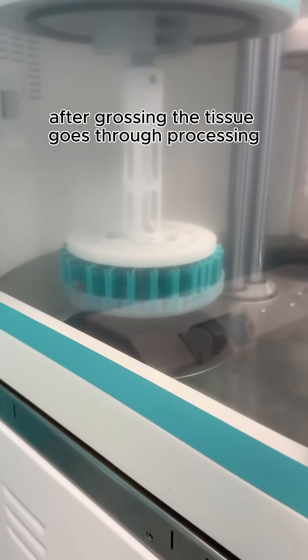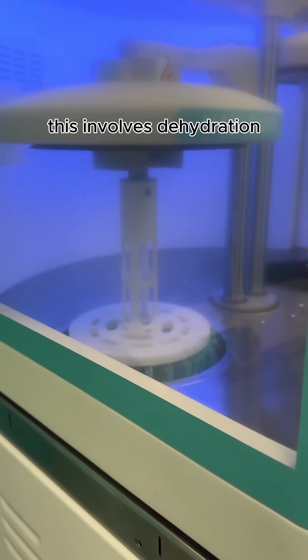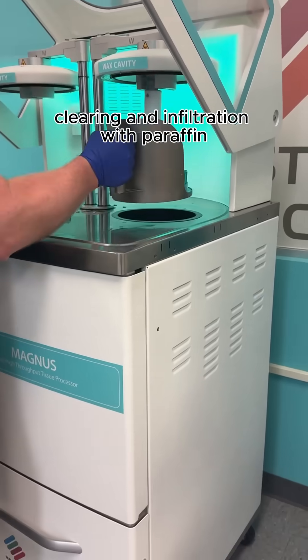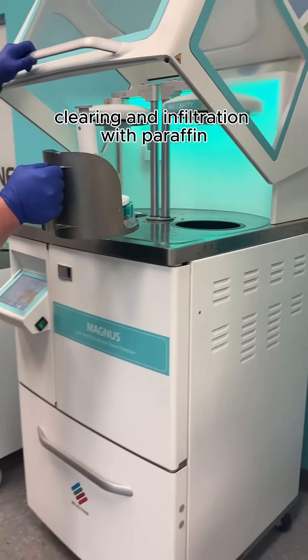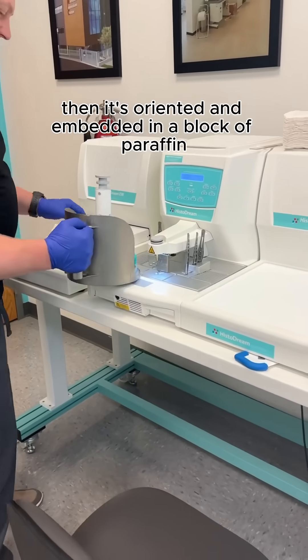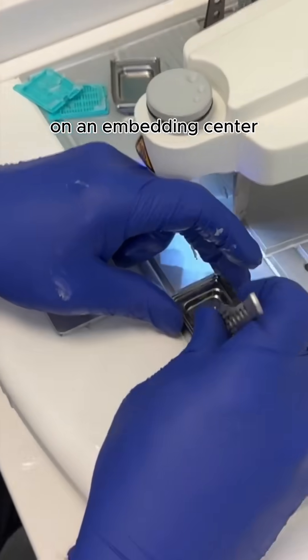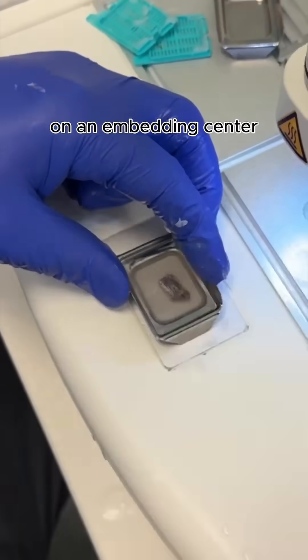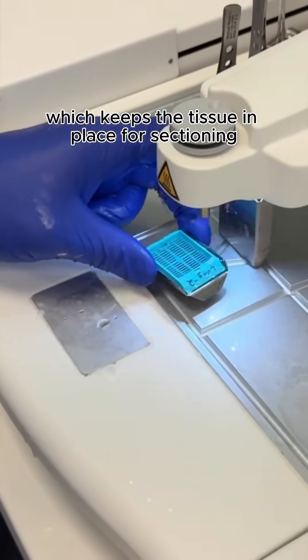After grossing, the tissue goes through processing. This involves dehydration, clearing, and infiltration with paraffin. Then it's oriented and embedded in a block of paraffin on an embedding center, which keeps the tissue in place for sectioning.